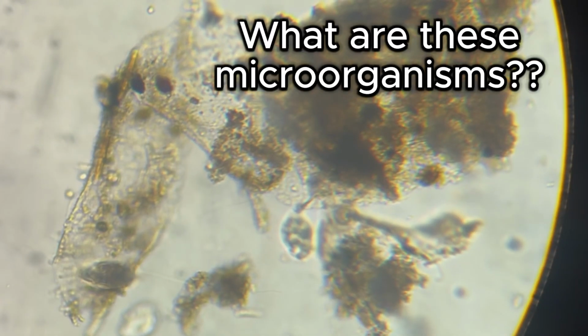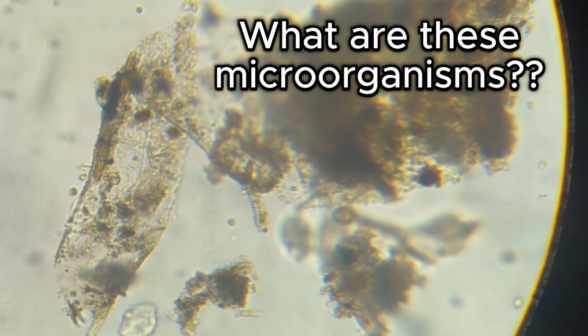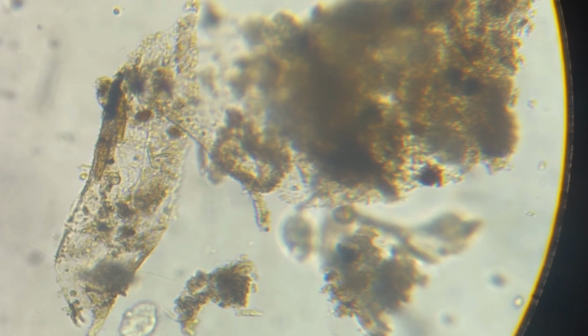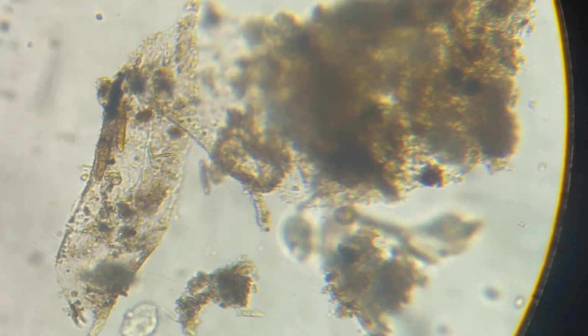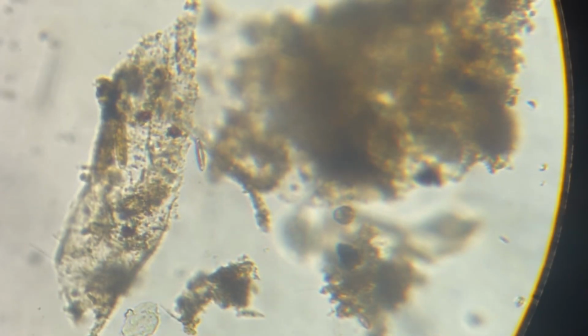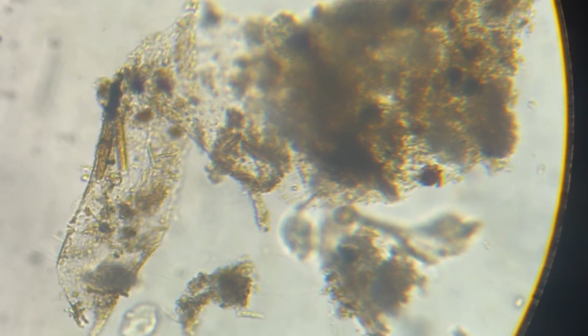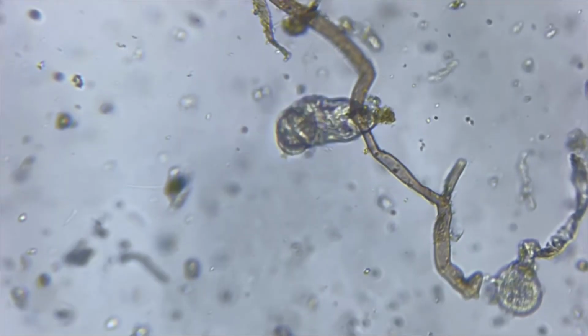Now, not everything that we find in the Microverse is easily identifiable. Here we can see some very long-celled organisms that are simply just moving up and down. And me and Seb are by no stretch of the imagination microbiologists, so if you know what they are, let us know in the comments.